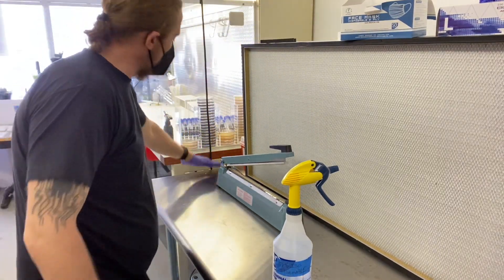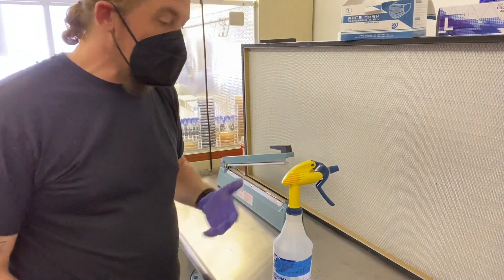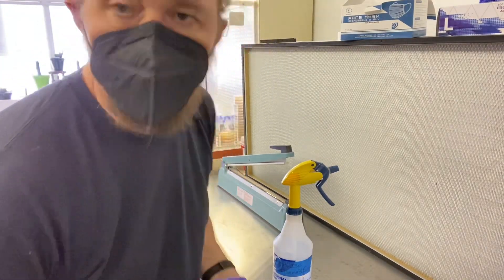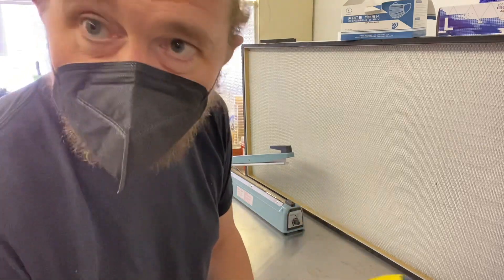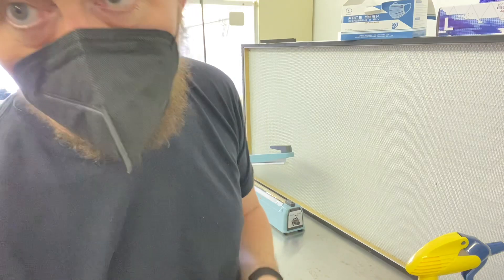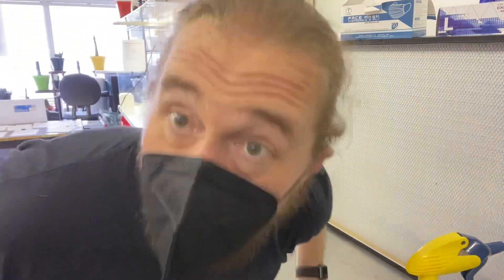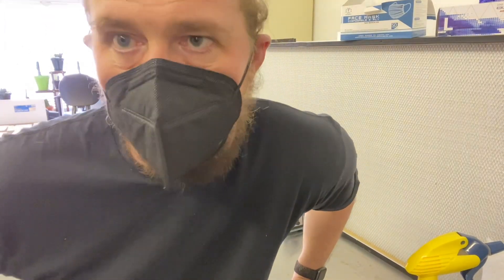I've walked up to a workstation. It's 7 o'clock in the morning. It looks clean to me, right? Wrong. After you've cleaned yourself and covered yourself up, the first thing you're going to do is wipe the workstation down. Because if it's been sitting for longer than a couple of minutes, it's probably got stuff on it. Iso.